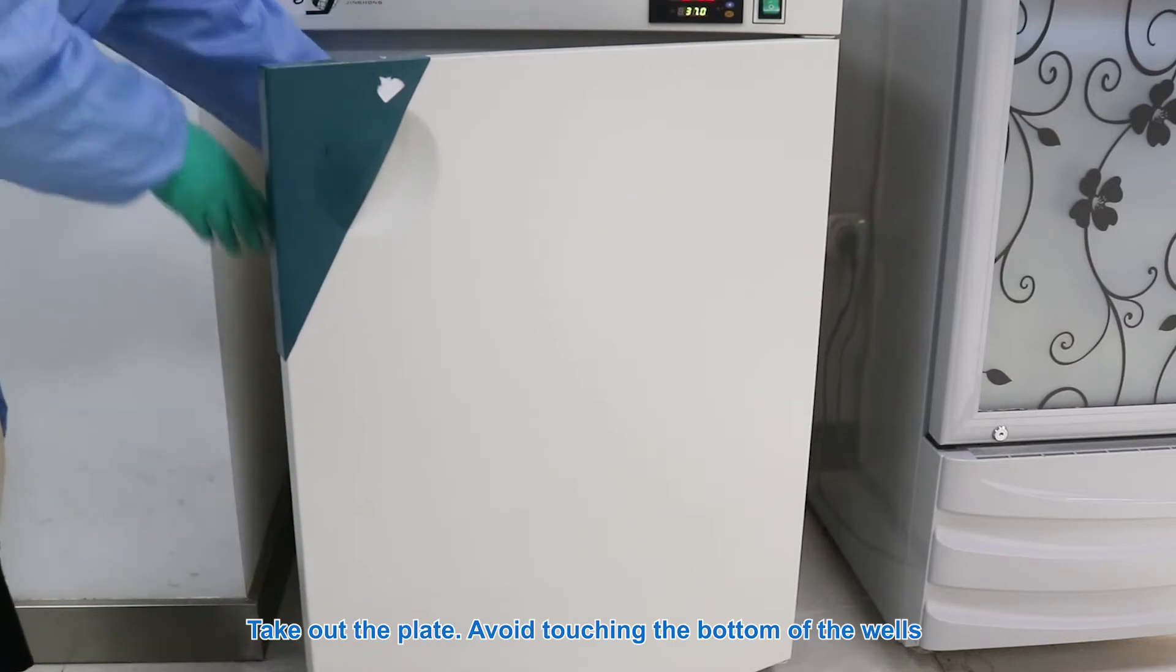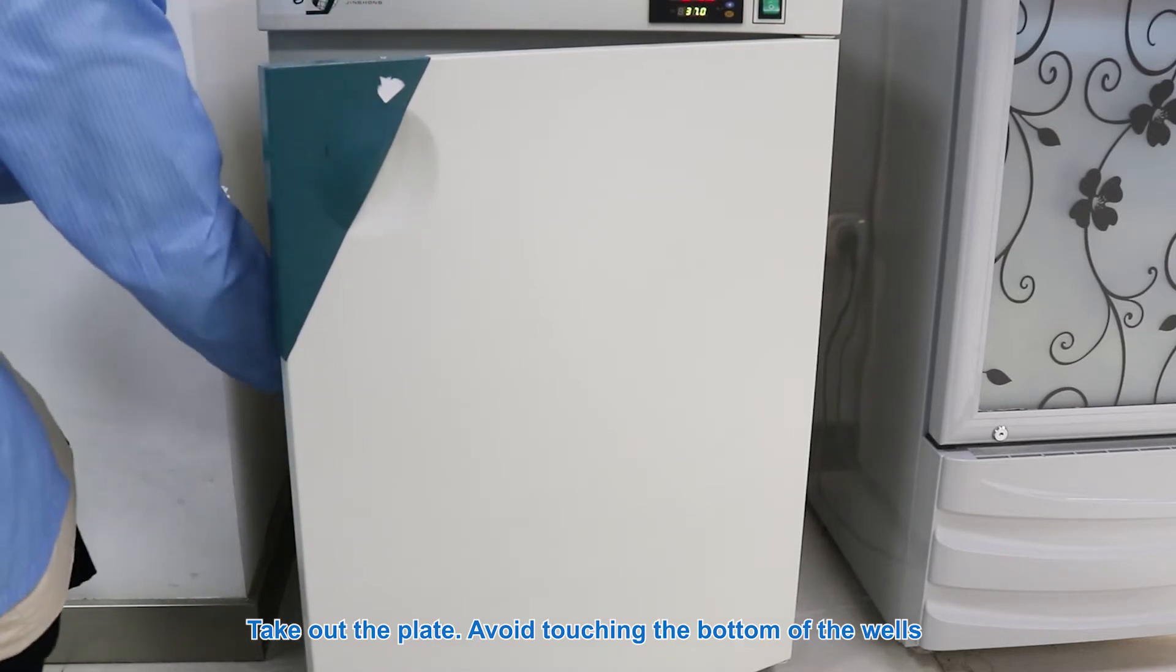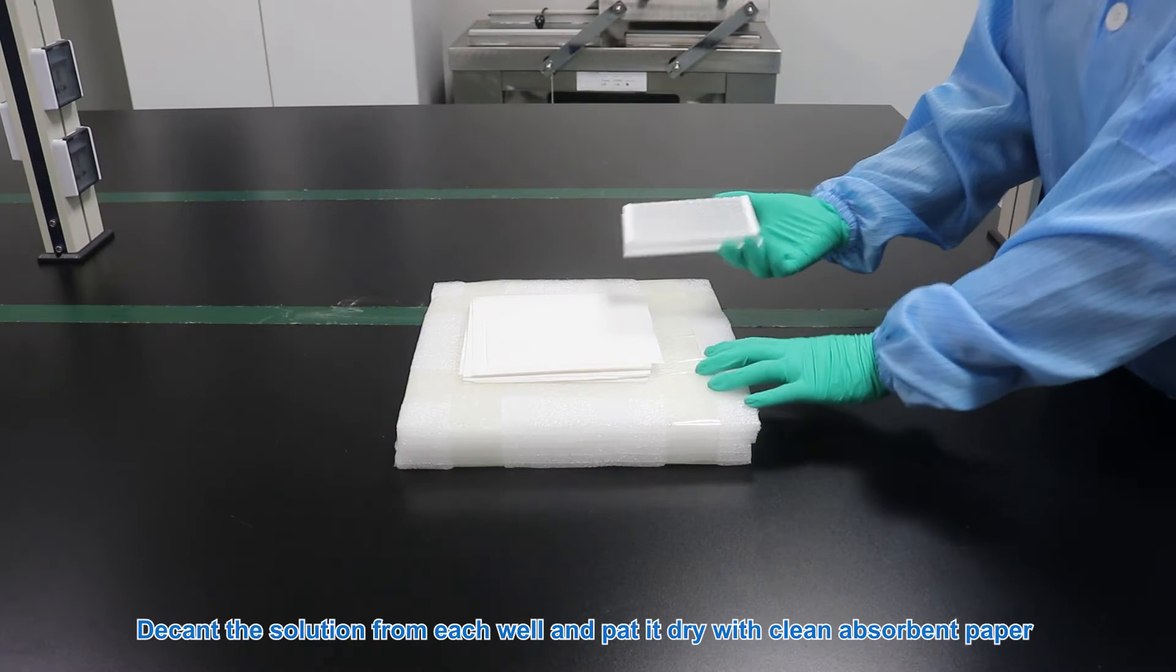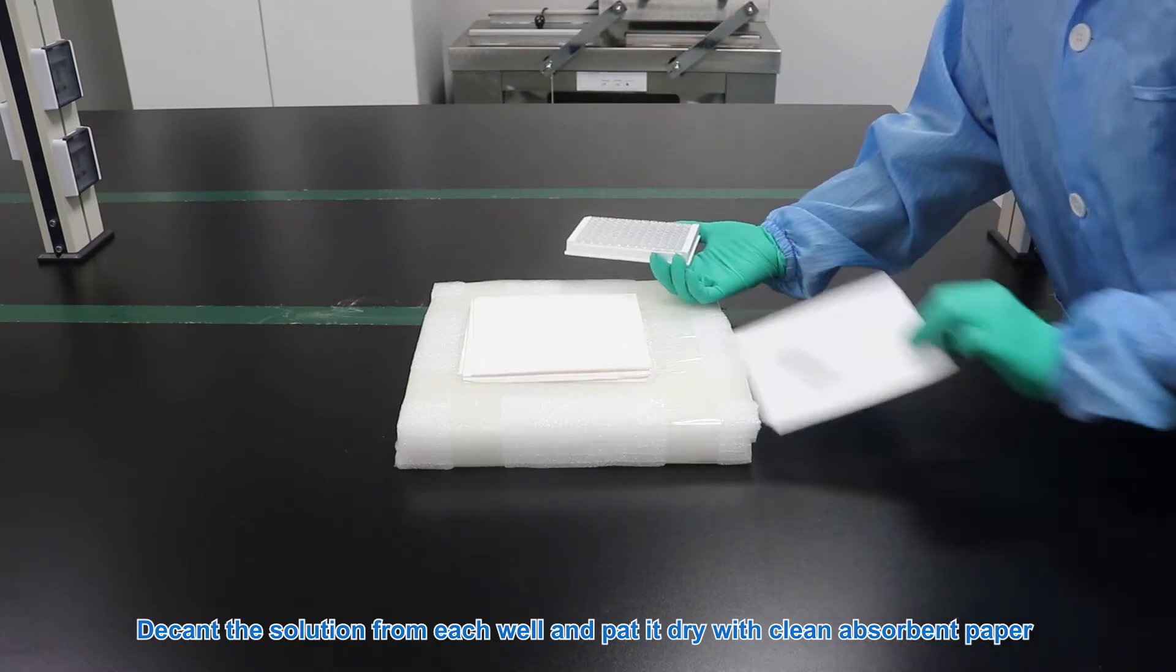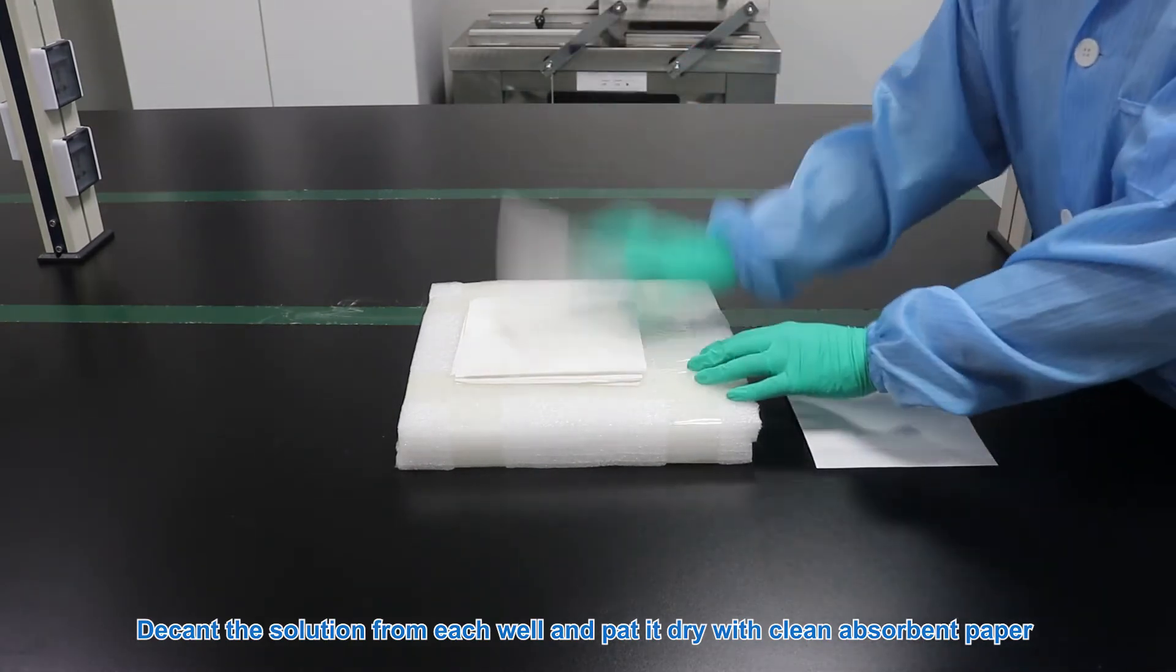Take out the plate, avoid touching the bottom of the wells. Decant the solution from each well and pat it dry with clean absorbent paper.